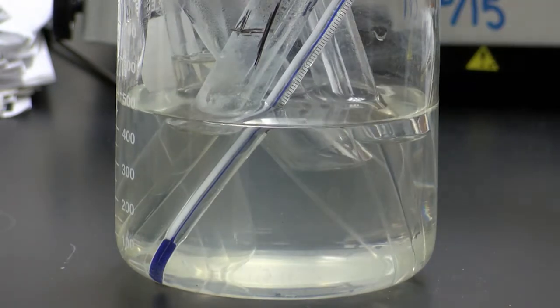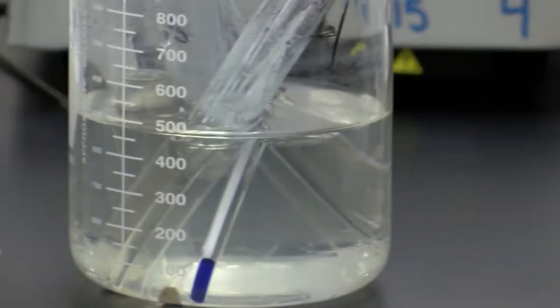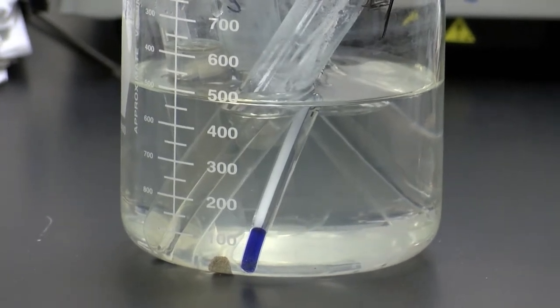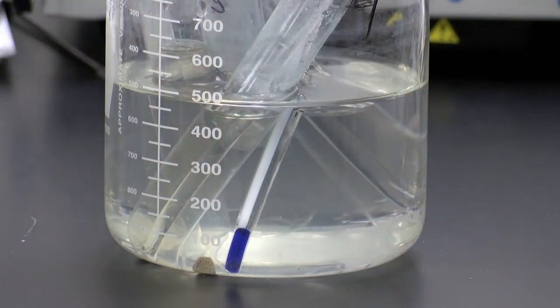And by the way, I did not mention the boiling stones. We have some boiling stones in here. Some of you who might be cooks or chefs know that often things that are boiling can bubble over, but if you put a little boiling stone in the bottom of your pot, usually sold at Bed Bath & Beyond or wherever, things don't bubble over.